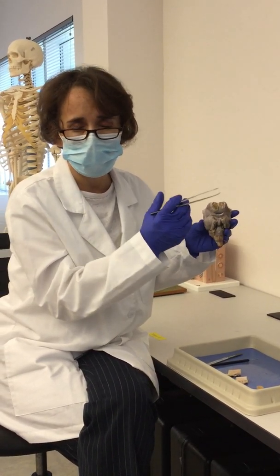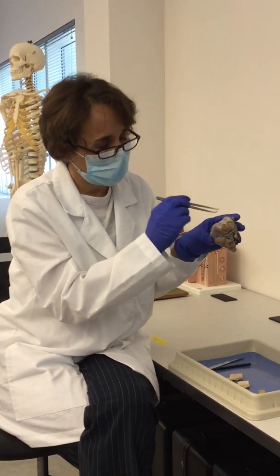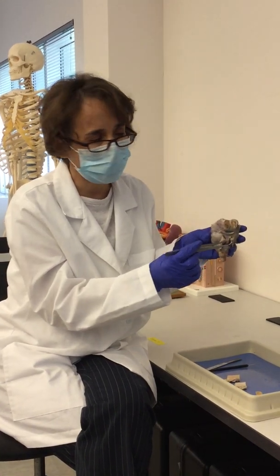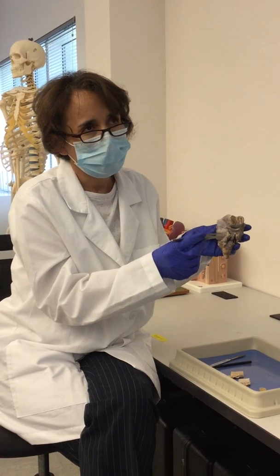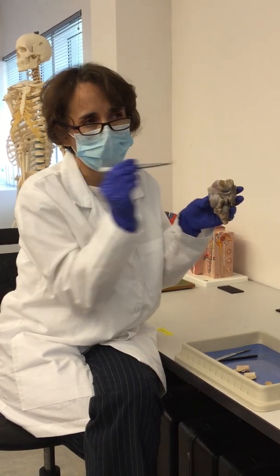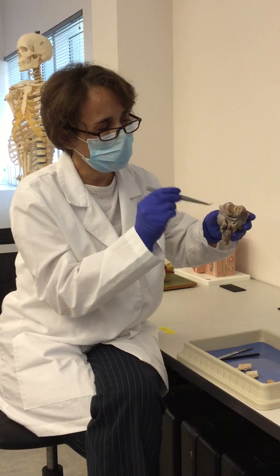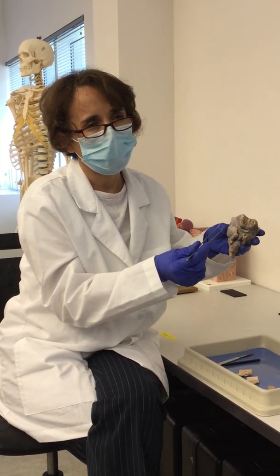and it's very thin, and it just falls into the indentations of the brain or the spaces within the spinal cord. And the arachnoid is located in between the dura mater and the pia mater, but it's made out of collagenous fibers and elastic fibers that at some point, rather than look like a membrane, look like a spider's web.